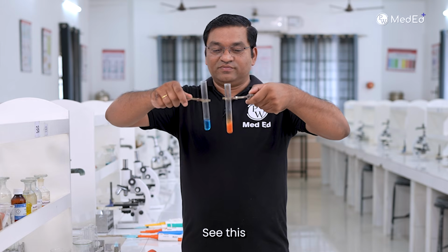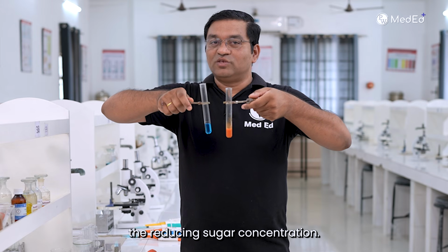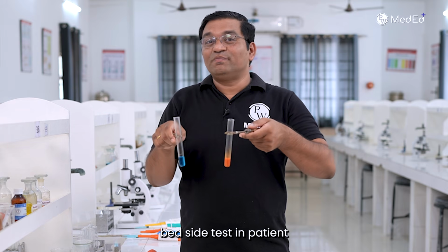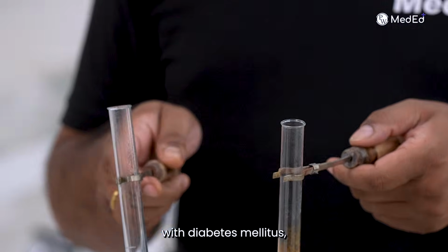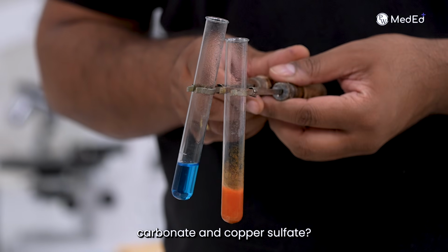See this brick red precipitate indicates the reducing sugar concentration more than 2 gram percent. This is positive Benedict test, bedside test in patient with diabetes mellitus. What are the composition of Benedict reagent? Sodium citrate, sodium carbonate and copper sulfate.